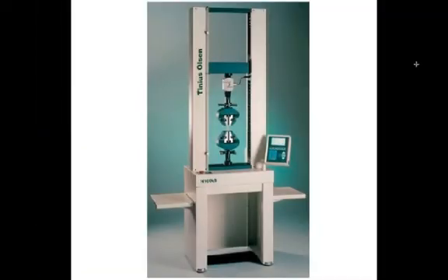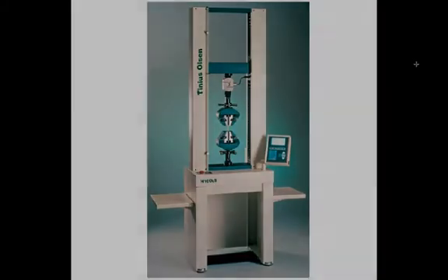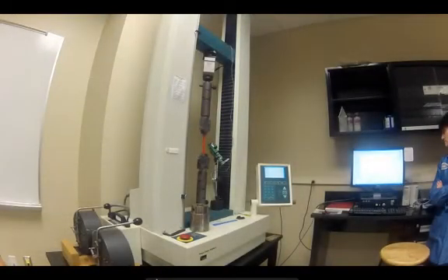This is the basic setup of a Tinius Olsen H100K-S tensile testing machine. This was our setup for our tensile test of the plastic specimens.